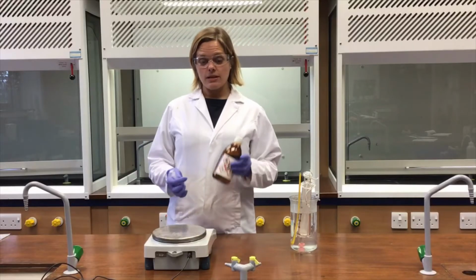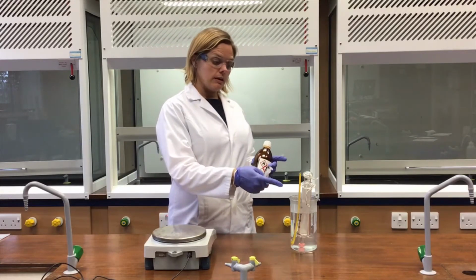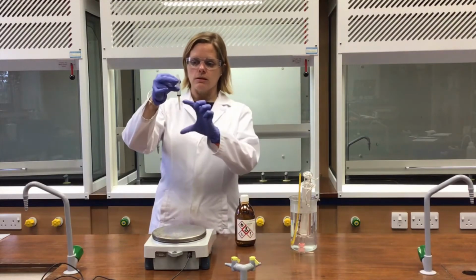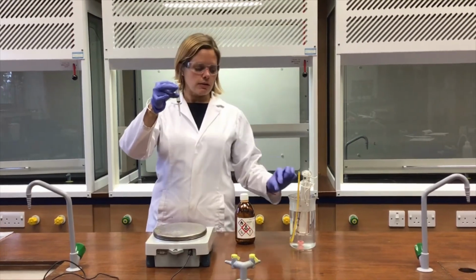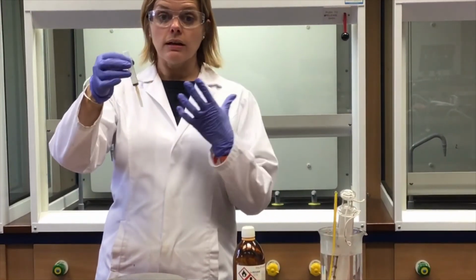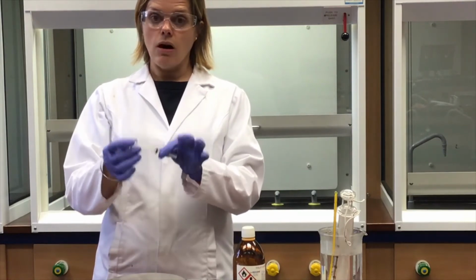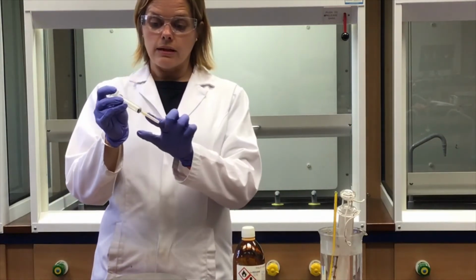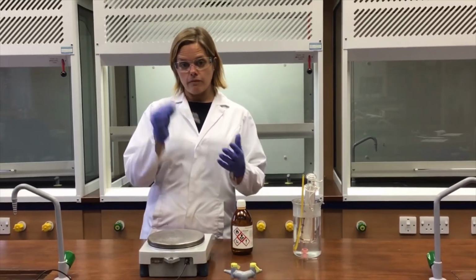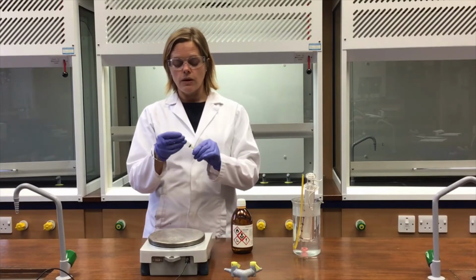So the next step is to add some of the hexane, that's a volatile liquid, into the gas syringe. And to do that, I'm going to use a hypodermic syringe. It's got a needle attached so I can inject through that little rubber self-sealing cap. But to be able to do that in a known quantity way, what I'd like to do is measure the mass of the syringe and the needle in the cap with some hexane in it, then deliver some hexane, and then re-record the mass of the syringe and the remaining hexane with all of this stuff still attached.